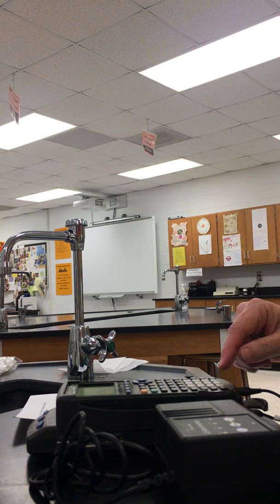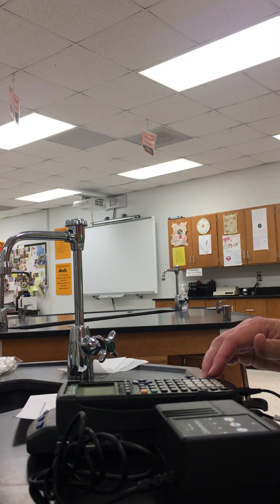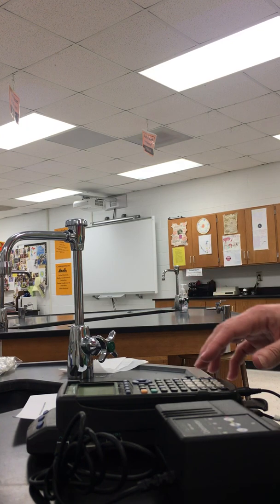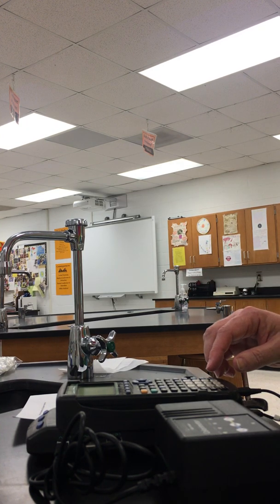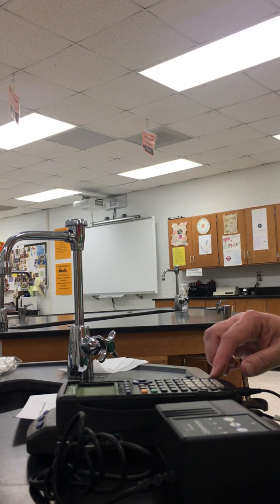All right, let's give it a try again. Let's try one more time with 1 for setup. Sometimes this machine's a little finicky, so we've got to get it going. So we're going to press 3 for 0. Select channel 1.